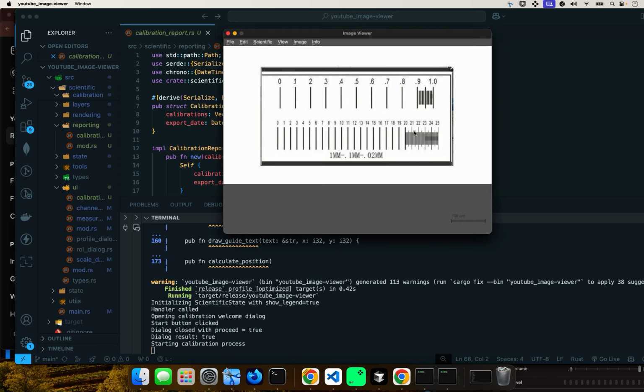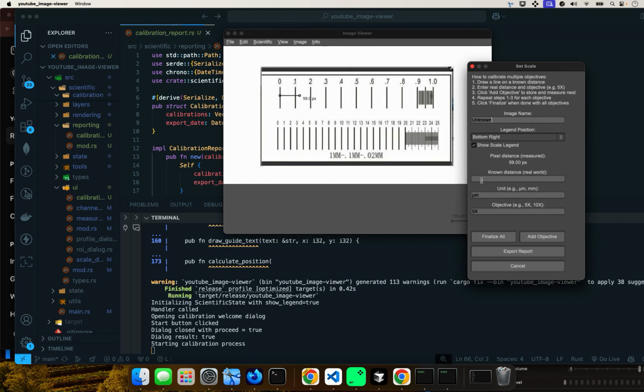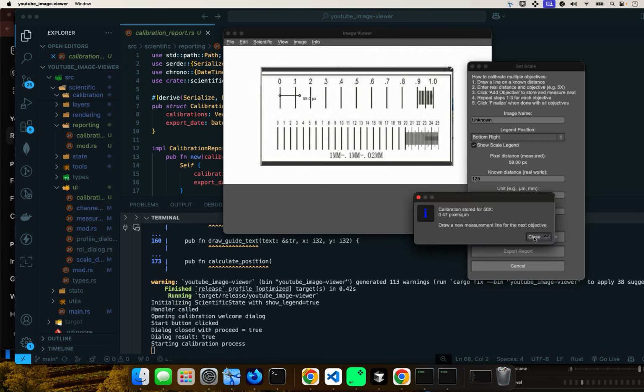Yes. So now we're almost done. Let's do 125 now. It'll be more or less here. And this one will be 125 microns. And then this one, let's call it 50x objective. And one more to go.